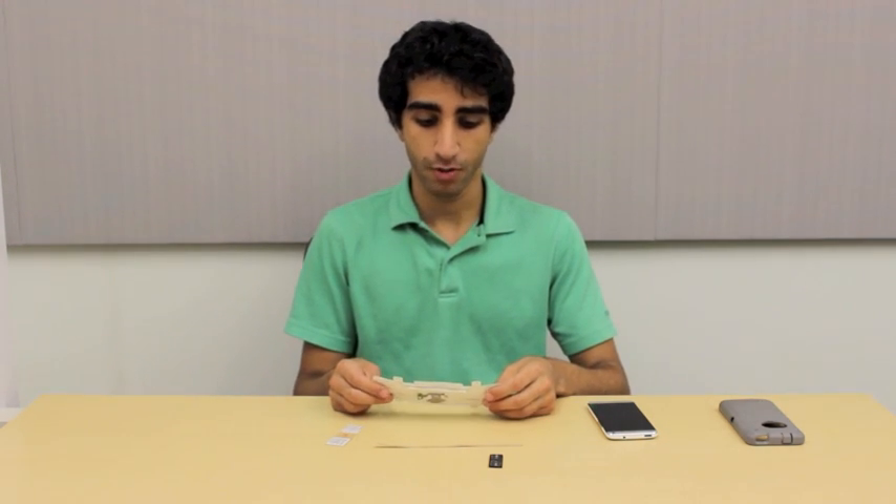Hello and welcome to this tutorial where I'll show you how to couple your foldscope to your cell phone using magnetic couplers. This is useful because it lets you document your images taken with your microscope, and it can even let you project your microscope images onto a surface.